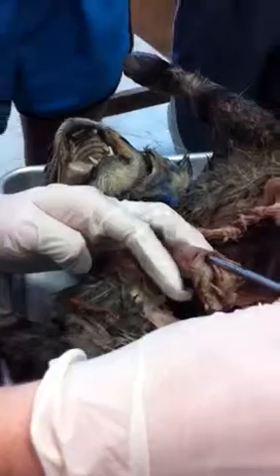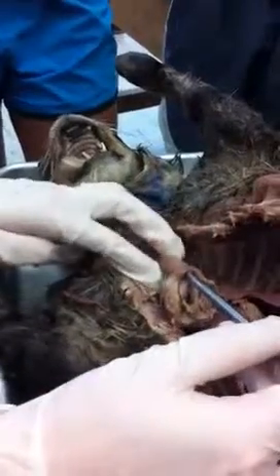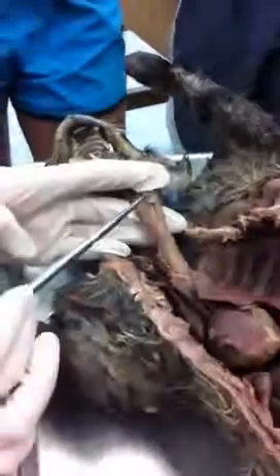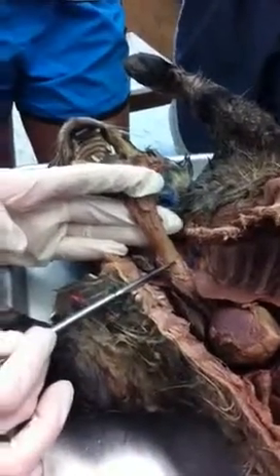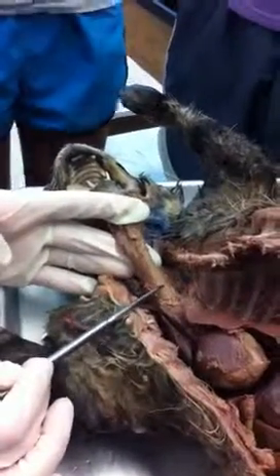Now, if I put my probe down here, what is this right here I'm pointing into? The esophagus. This is the esophagus. This is on the back portion, with all this nice flattened tube here. Whereas on the anterior portion is the trachea. And you see the C rings in here made of what?